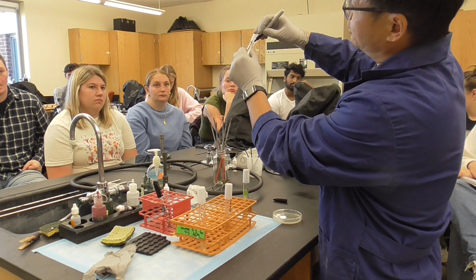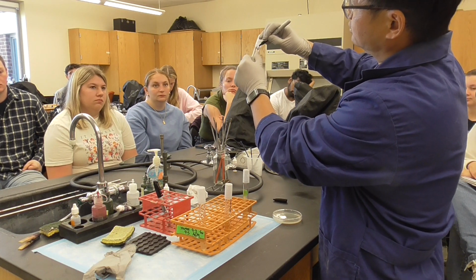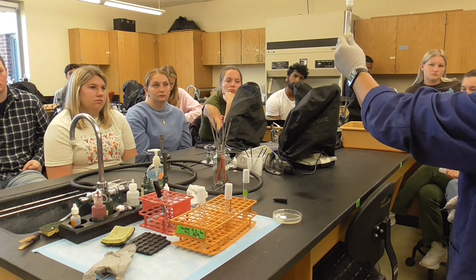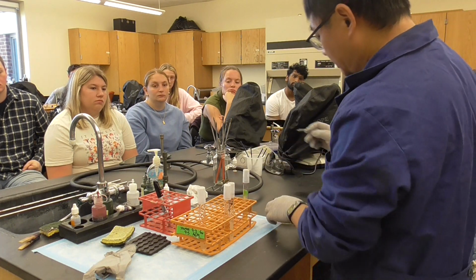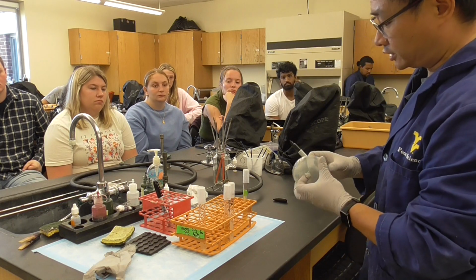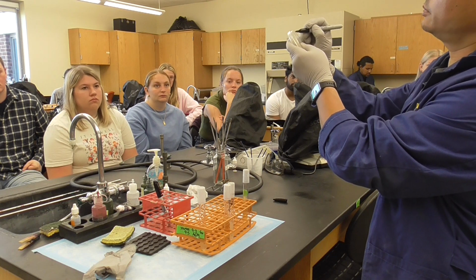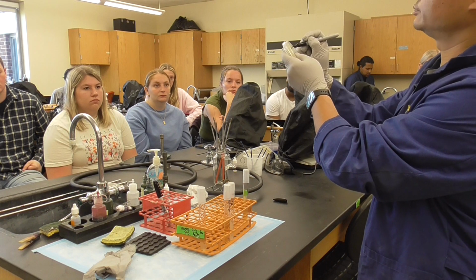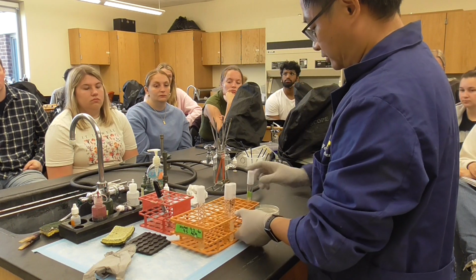Okay, now the bacteria name, Bacillus subtilis, and the date 09/10. So what you're going to look at on Thursday is clearly on the top. Now the agar plates, we mentioned never label on the lid, so you have to label at the bottom. So we're going to label my initial, bench number. This will be unknown and also will be 09/10.